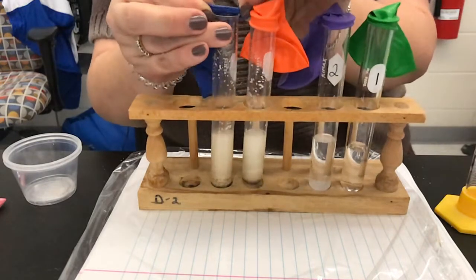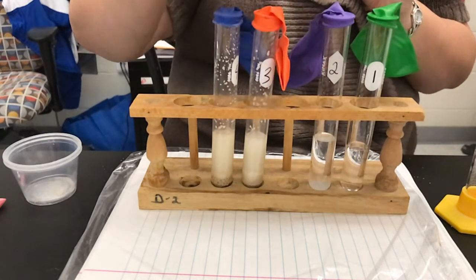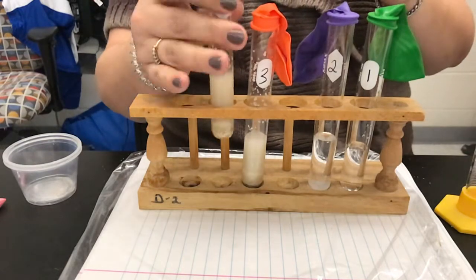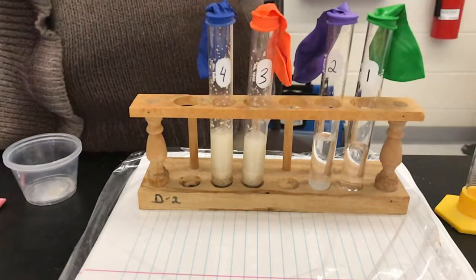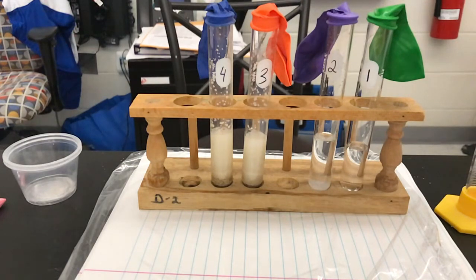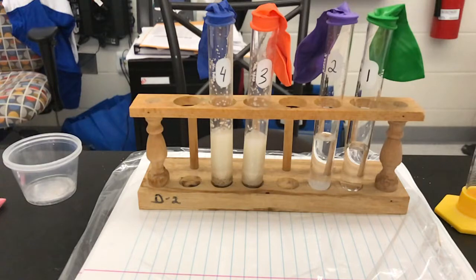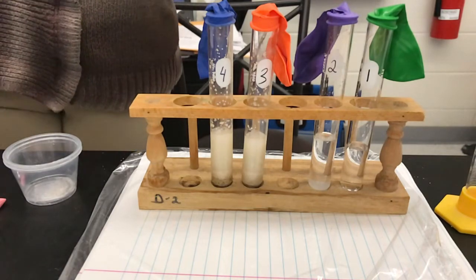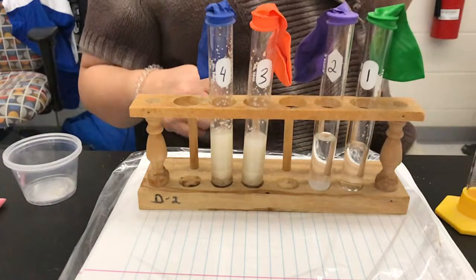And then we're putting our balloon on. So that's four, three, two, and one. What we need to do is after five minutes, we're going to make some observations. They've been sitting there already for about 30 seconds, so I'll do it at the 4:30 mark. And then after another 10 minutes, we're going to make some more observations.